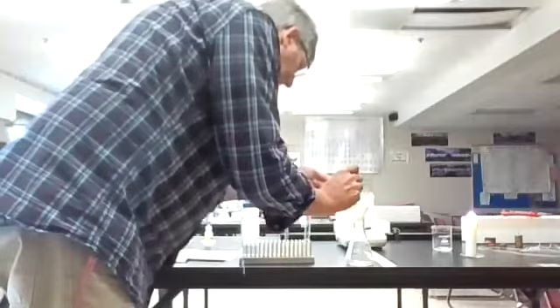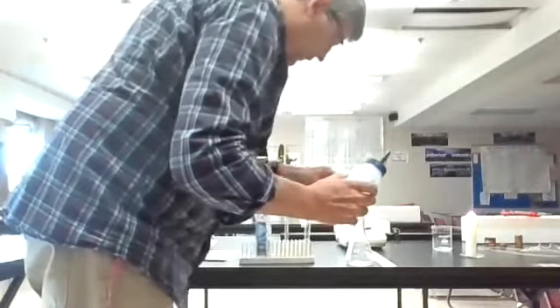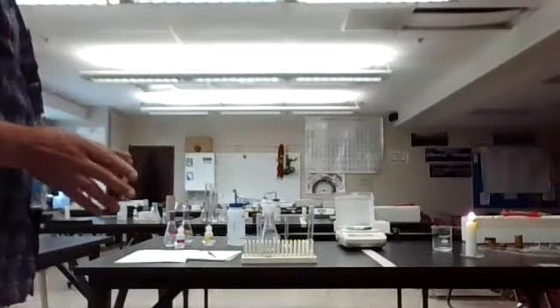What I'm going to do is go ahead and filter this. And I left a bunch of my white stuff in the bottom. What I'm going to do is use a little bit of distilled water, spray that in there, try to get it to come through as best as I can. And there, the test tube is empty, so that should work exactly how we want it to go. Okay, we're going to let this filter for a little bit. Gravity filtration does take a little bit of time.